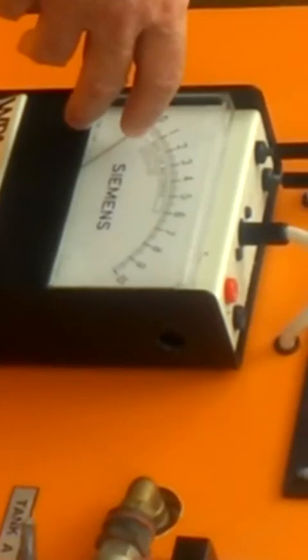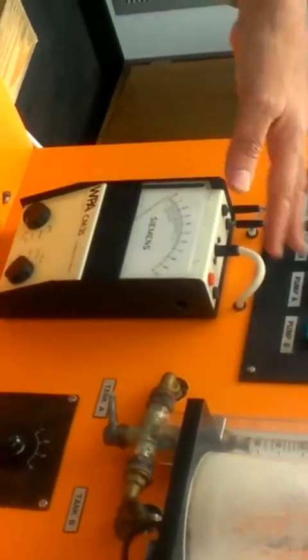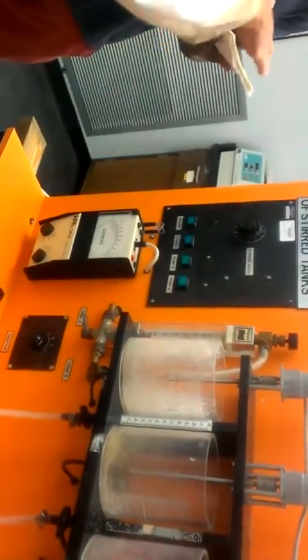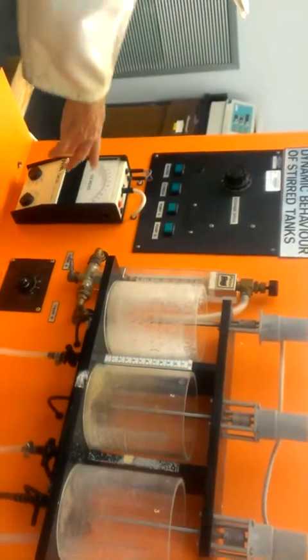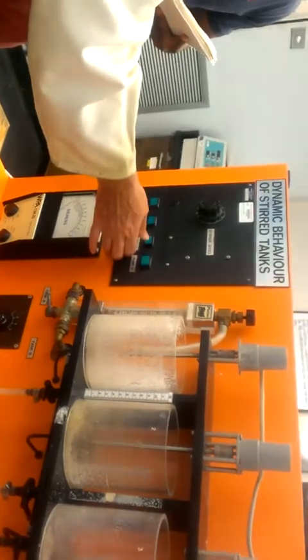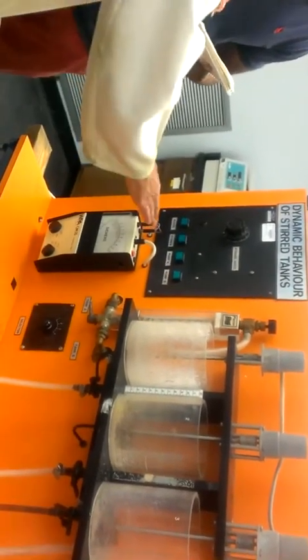So you take samples about every 10 seconds, 20 seconds. So you measure a sequence of values. So, at the beginning, pretty soon you will see that the conductivity will level off, and it was very low. At time equals 0, when you start the experiment, you switch off the water and switch on the salt. So what will happen?